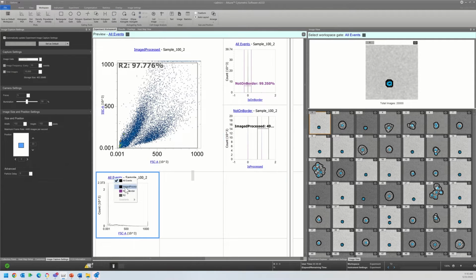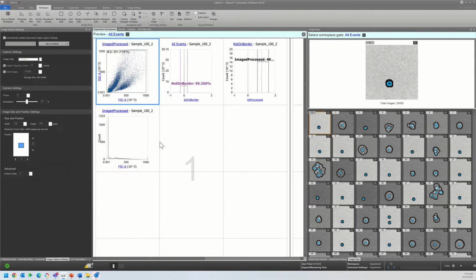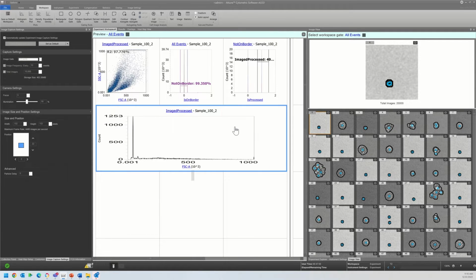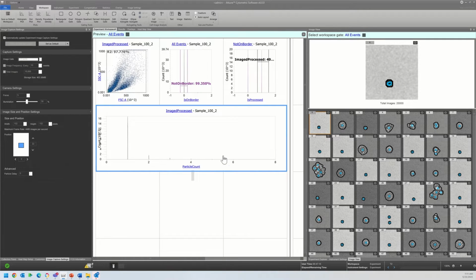So if I come over here, now we're going to image processed, and this is where we are going to set our singlet gate using the particle count feature. So the first thing that I've done is I've set the image and processed gate as my parent gate, and then I'm just going to go to object feature particle count. You can see I have singlets, doublets, and then the aggregates.